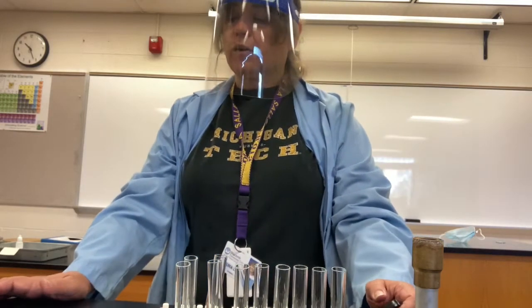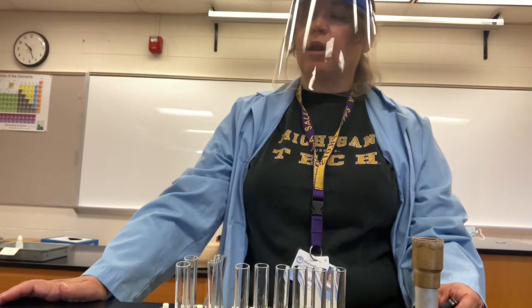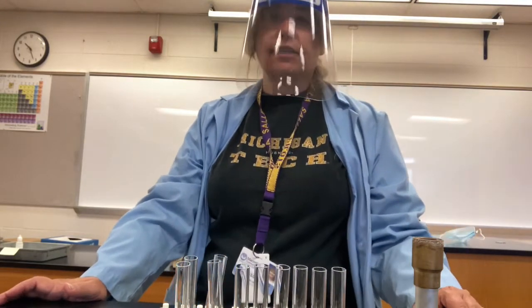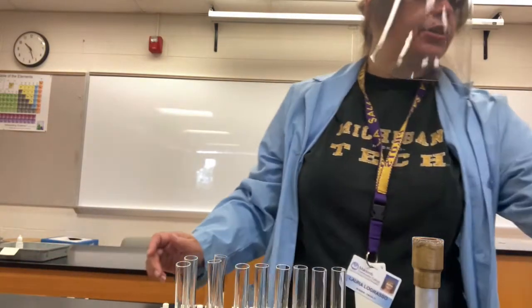This video is going to demonstrate Experiment 6 in the Chem 1050 Lab Manual, Chemical Properties of Consumer Products. We're going to start with the procedure, Part 1, Analysis of Table Salt. It says to take a small amount of table salt and put it in a test tube.